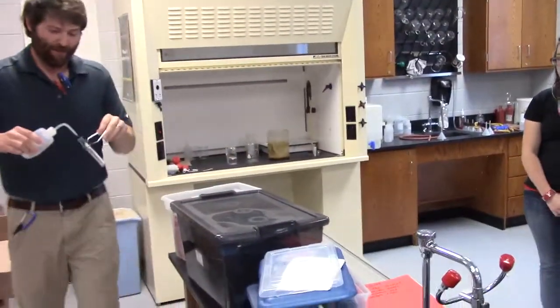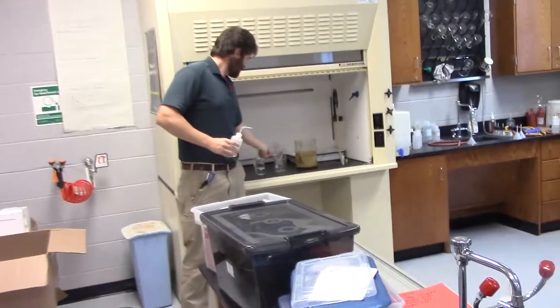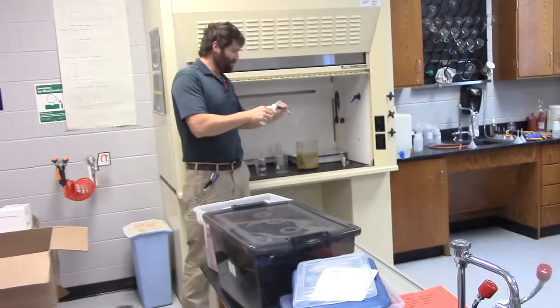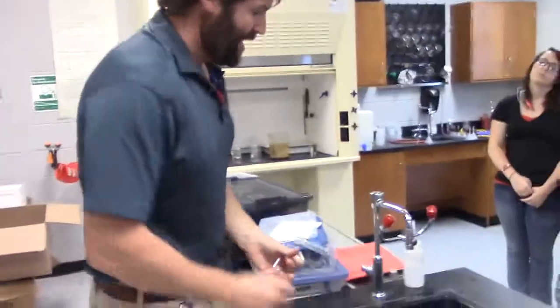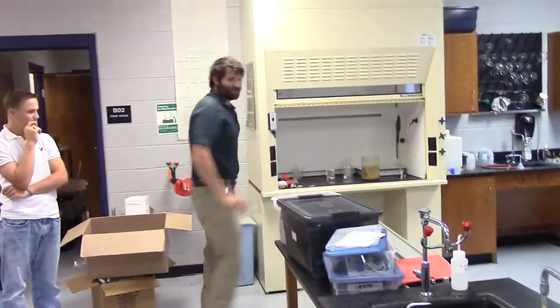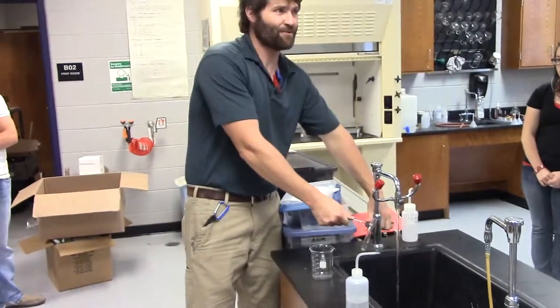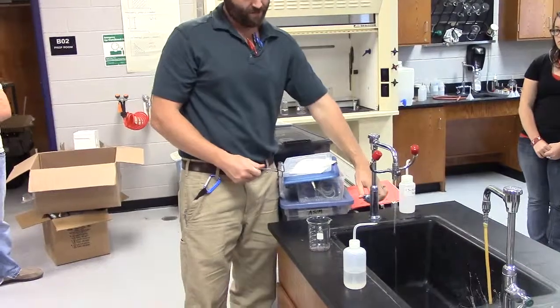I would spray this thing. I'd spritz it up more with water. And I would sit here and spritz it up with water. I would spritz. You get the idea? I would rinse it out a whole crap load of times. And then I would carefully, matter of fact, I'll be honest, what I would probably do, sure as the world, one of y'all will try and stick this under a sink, and guess what you'll do? Splash acid on you. You'll splash acid back up on yourself.